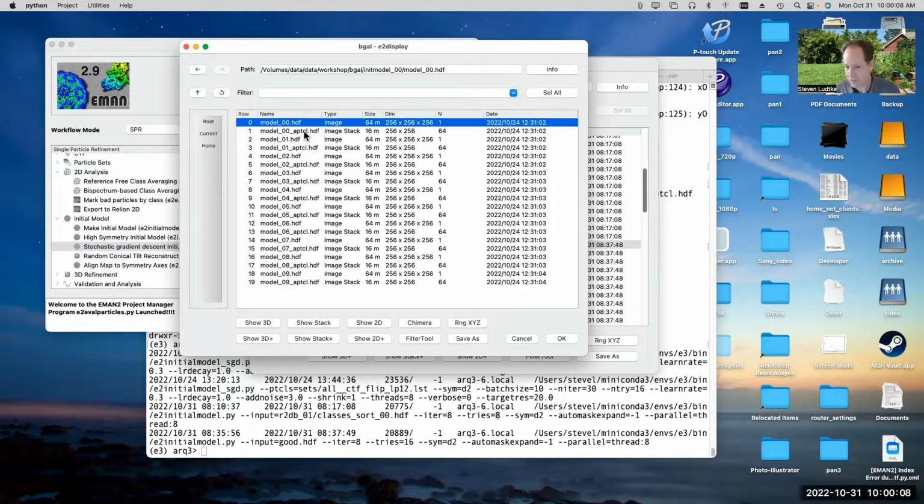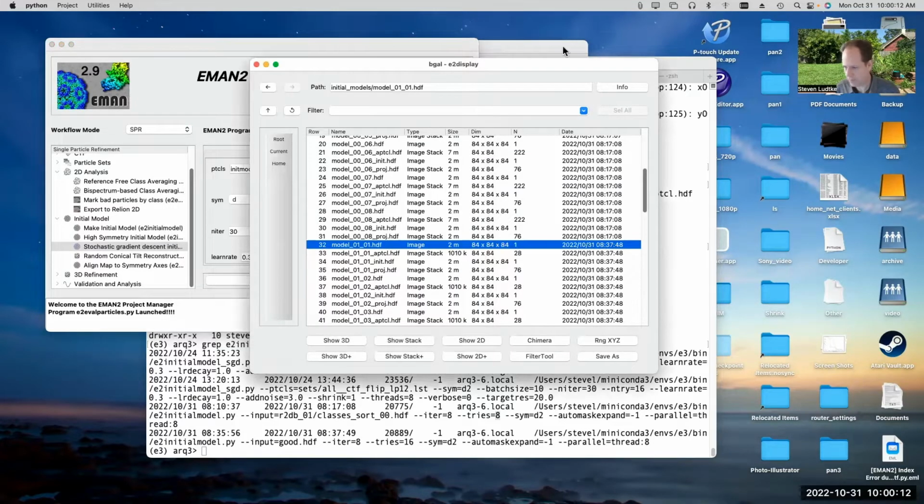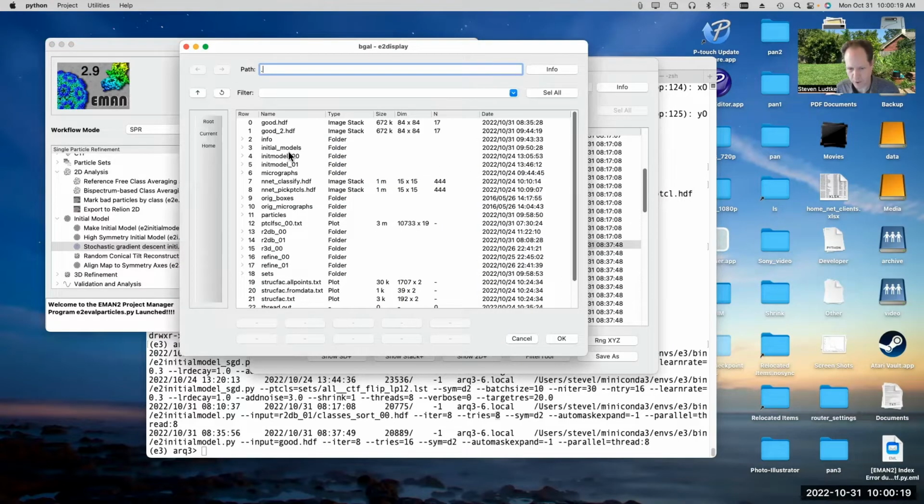Now when I ran this the first time, I ran it with class averages just to show you, oops, sorry, that was the wrong window I was using. That's fine. Let me put that back to what it was before. Well, it doesn't matter, I'm just gonna cancel.